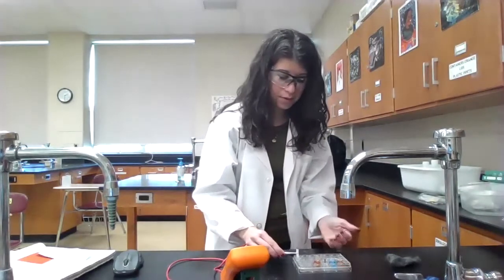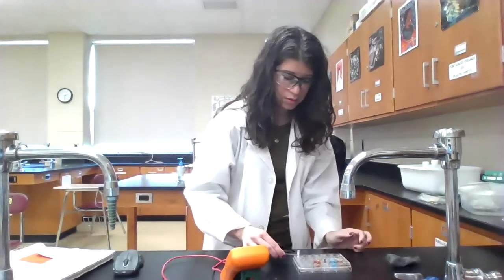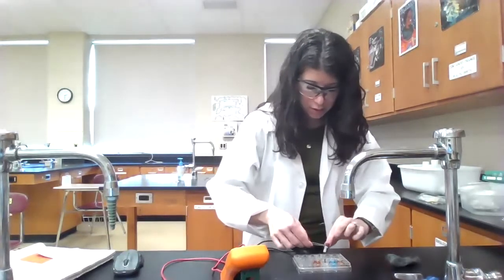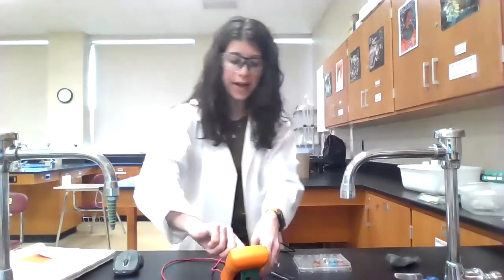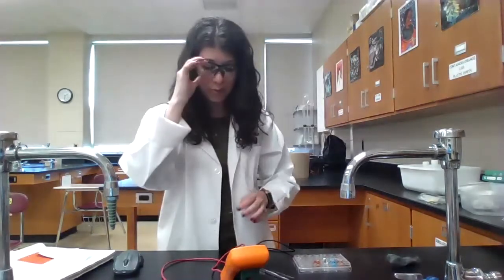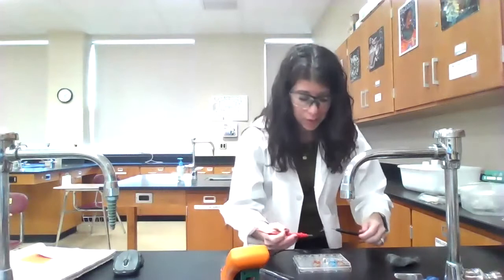And then we get our piece of filter paper. And we're going to connect them. Now, this one I am going to set to 20 volts because I should actually get a reading a little bit above 2. So if I set the sensitivity with a maximum at 2, I won't get the correct voltage. So that's why I'm setting it with a sensitivity all the way up to 20, because that way I would get readings above 2 volts.